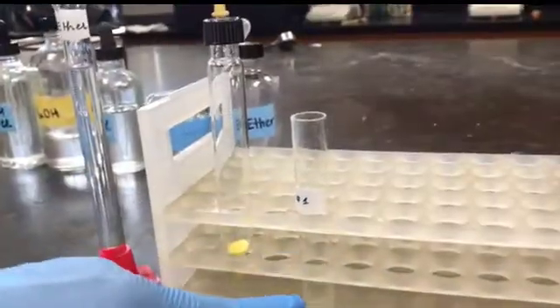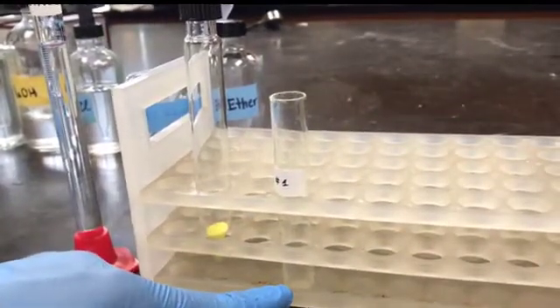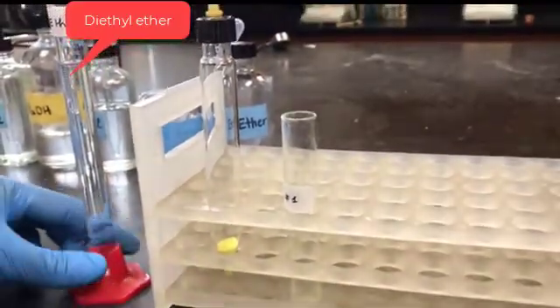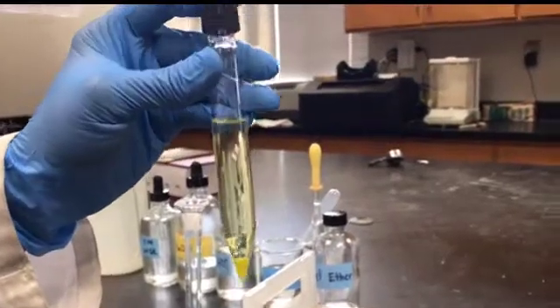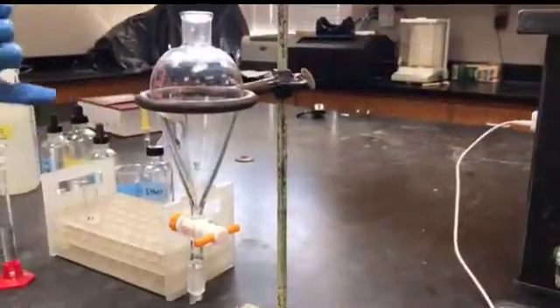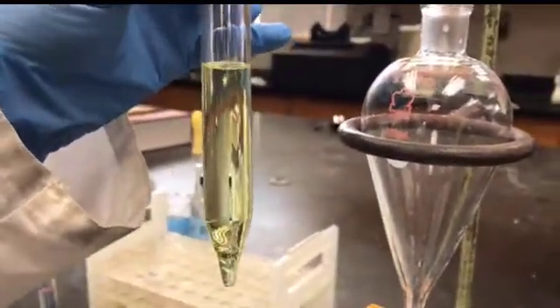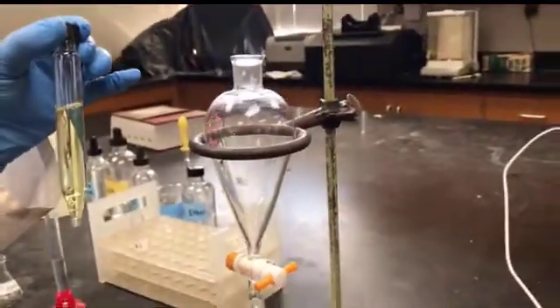I transferred the 0.36 grams of mixture of the neutral compound and the acid impurity into the screw cap centrifuge tube, and then I'm going to add 10 milliliters of ether into it to dissolve it. I've already added 10 milliliters of ether to that mixture. So this is the centrifuge tube containing 10 milliliters of ether and the solid mixture. Now it's completely dissolved. I'm going to add this solution into the separatory funnel now.